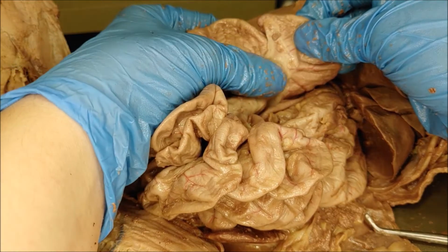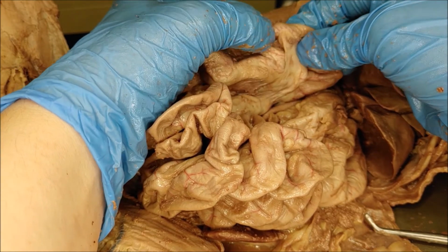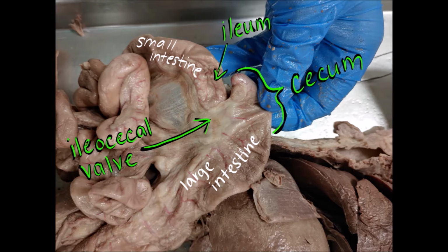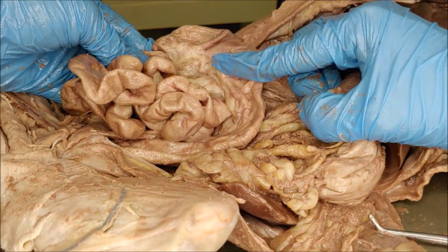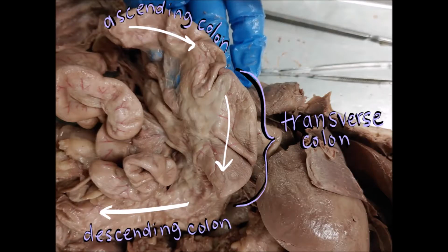At the ileocecal valve, right here is where you would find the appendix in humans at the very end of the cecum. Cats do not have an appendix, but if we were looking at human intestines, that's where you would find the appendix. And then the large intestine is separated into sections. So the ascending colon, the transverse colon, and the descending colon. So ascending, transverse, and descending.